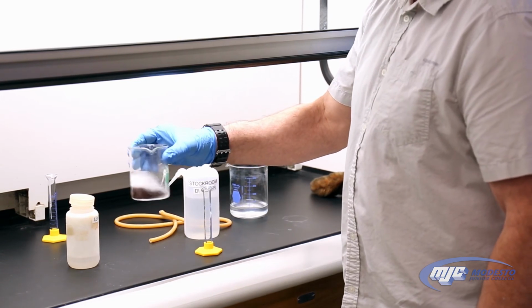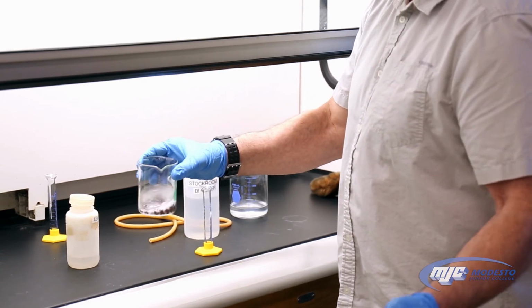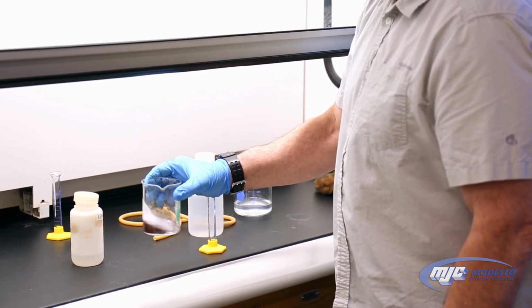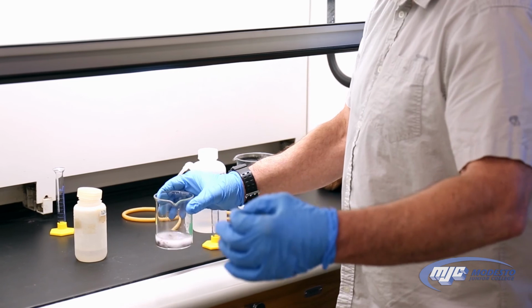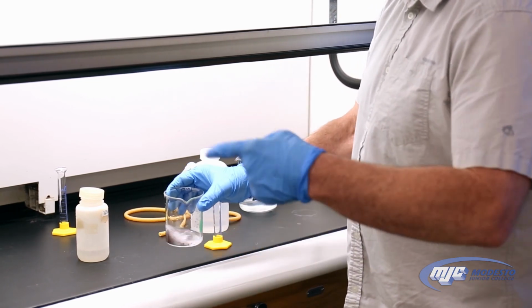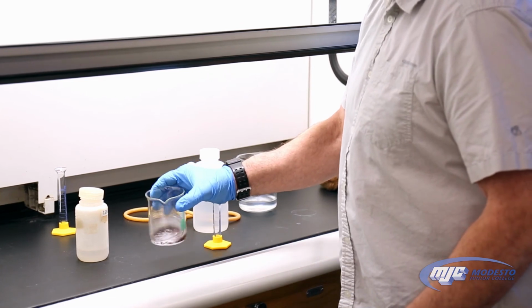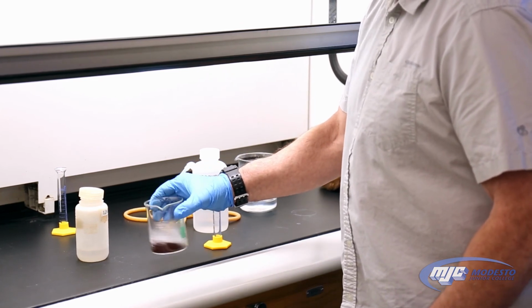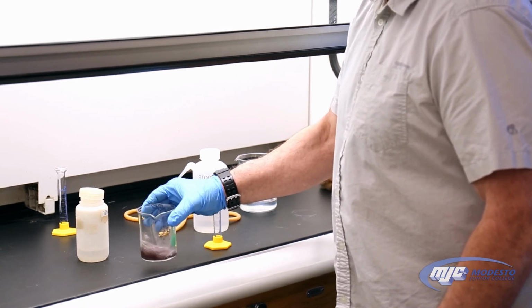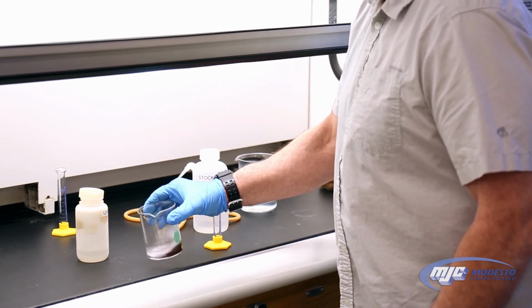That's the hydrogen gas that's being produced by the reaction of the zinc metal with the hydrochloric acid. So we'll know that our reaction is finished, that all the zinc has been removed, when there's no more fizzing. Not exactly removed. The ions are still in there, but they're ions in solution. They're not solid zinc metal anymore. Sometimes it takes a little while. Just give it a stir every now and then and let it react.